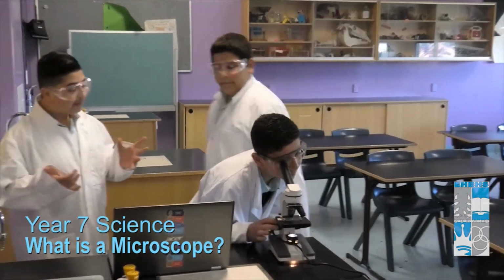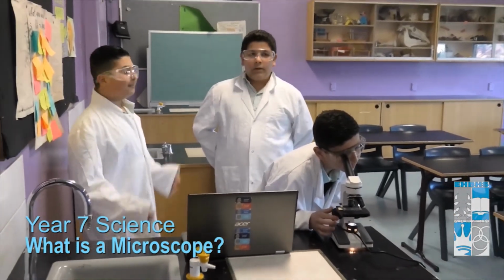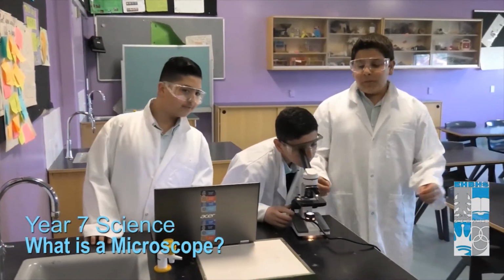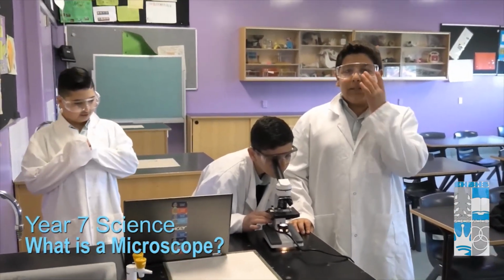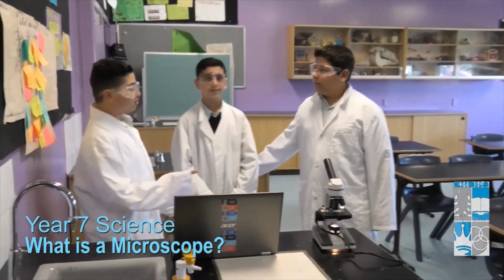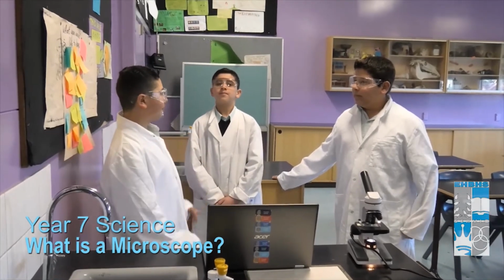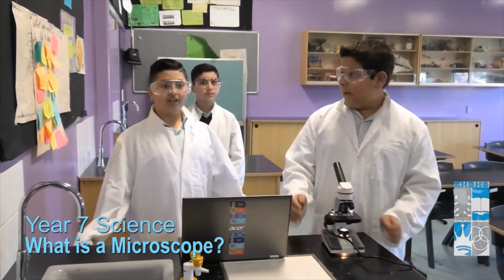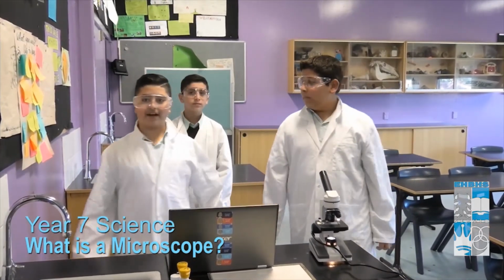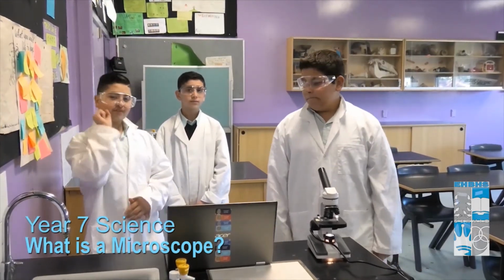Let me ask you now, as you examine the microscope, what's the purpose of a microscope? The purpose of a microscope is to zoom into things that are impossible to see with the naked eye. It is a device used to see very small and insignificant objects. For example, here you can only see blood, but if you zoom in, you can see little hairs and all that. Like yesterday in science, we studied the letter e. We had to cut out some newspaper, find the lowercase e, and cut it out, not too small, just to fit under the eye lens.